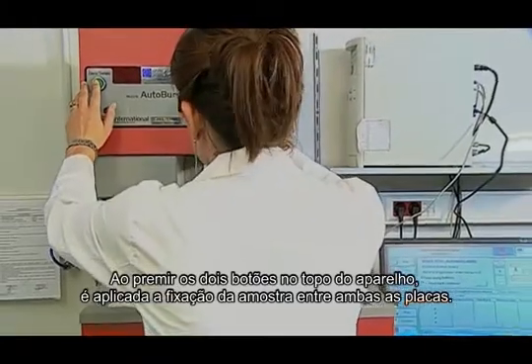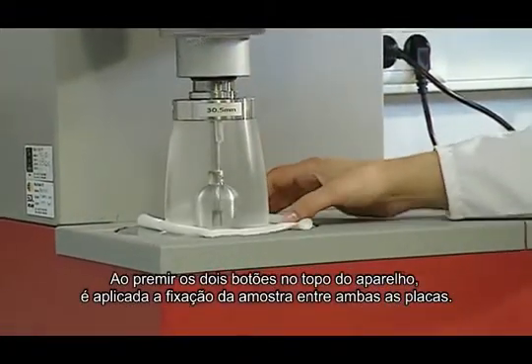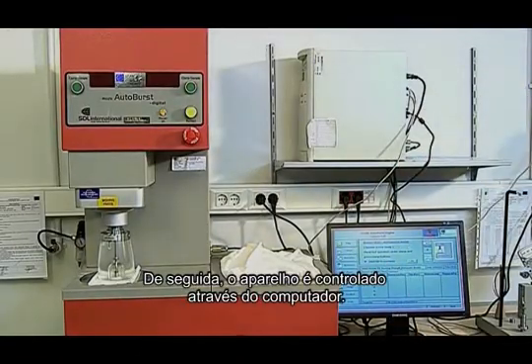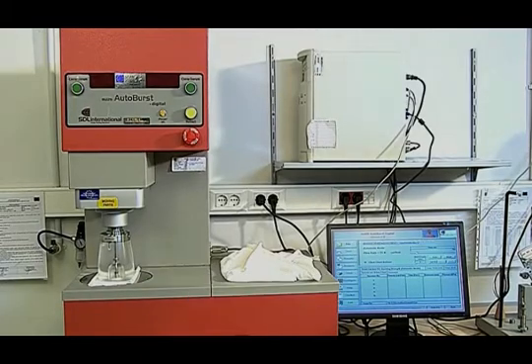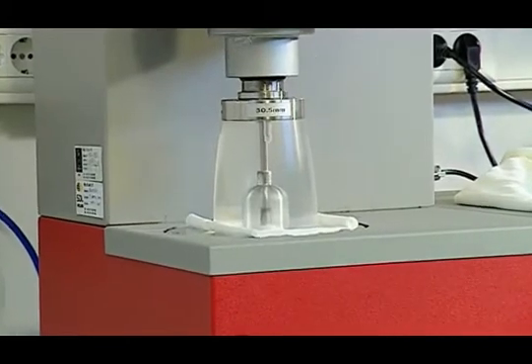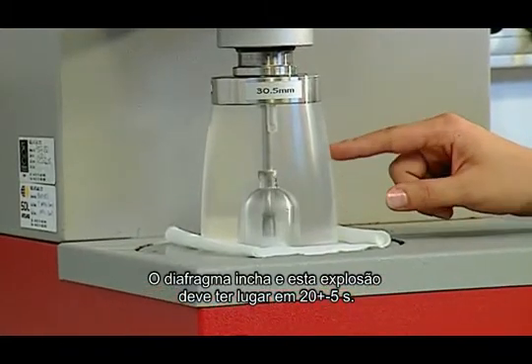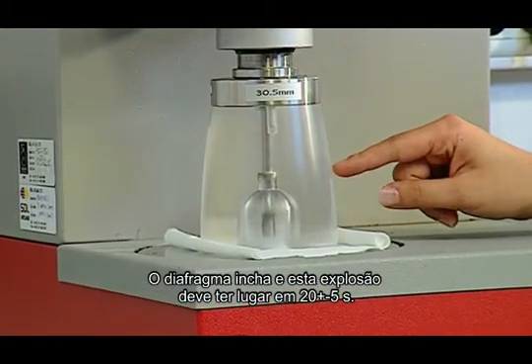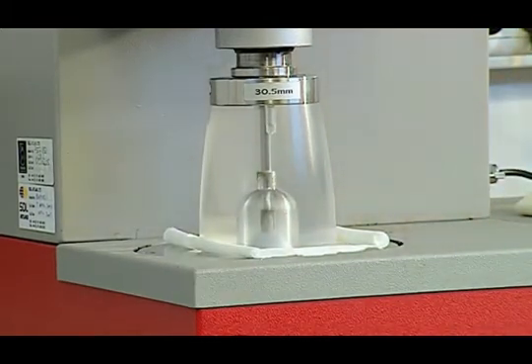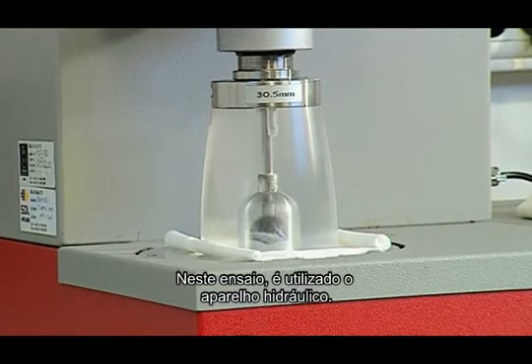By pressing 2 buttons at the top of the device, we make it clutch the sample between 2 plates. Then we control the device with the computer. Pressing the OK button, we start the device. The diaphragm is swelling with the air from below with glycerin, and this explosion should take place at 20 plus or minus 5 seconds. We use a hydraulic device in this test.